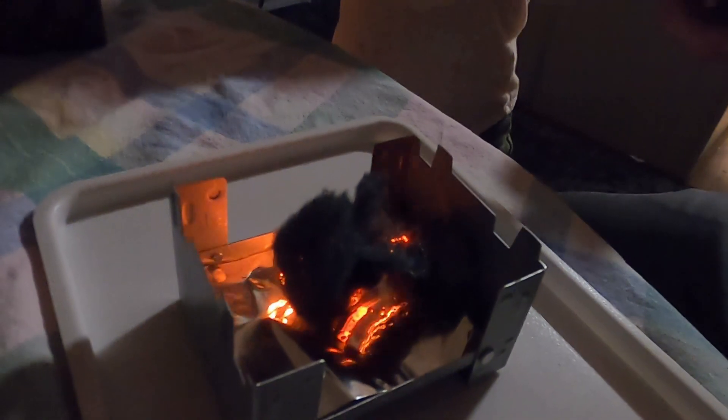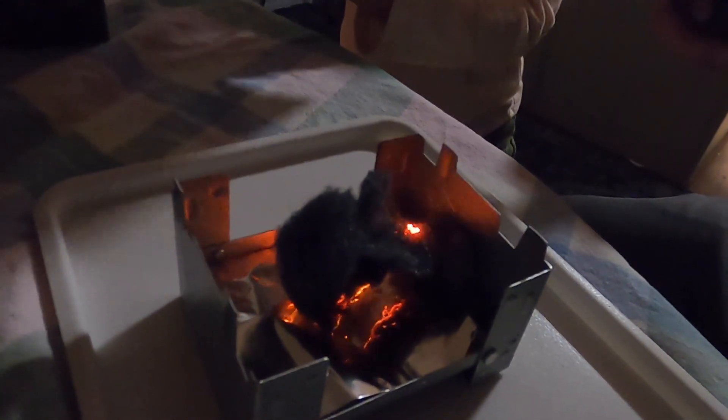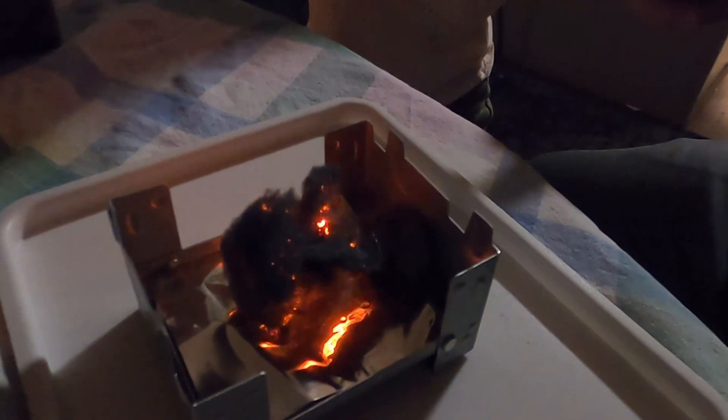My turn. Steel wool fibers do not have much bulk to them. Heat quickly accumulates in one place, making the iron react with oxygen — i.e., burn. That's what we're talking about. This produces even more heat, which further intensifies the process.